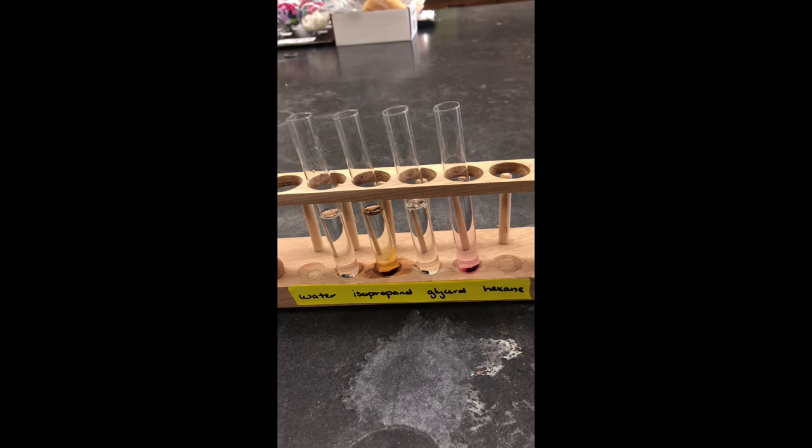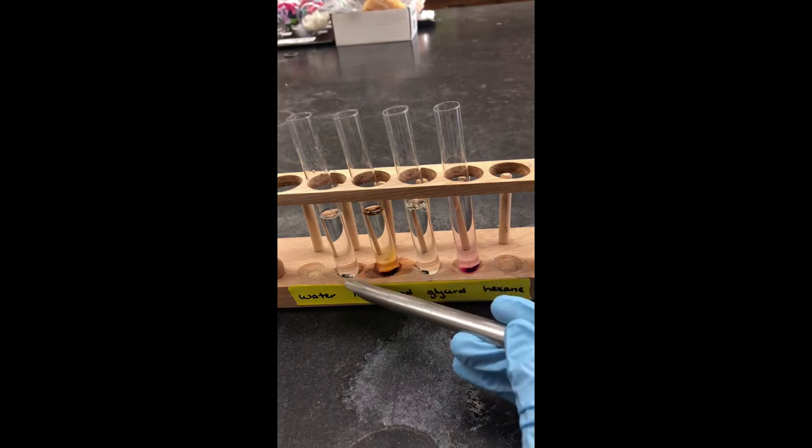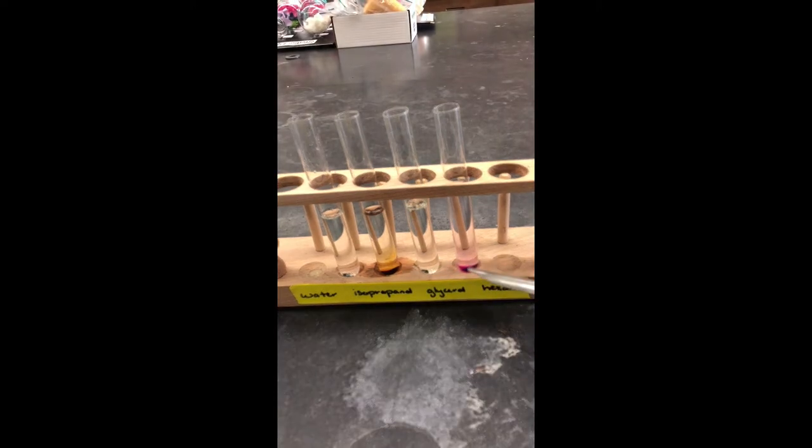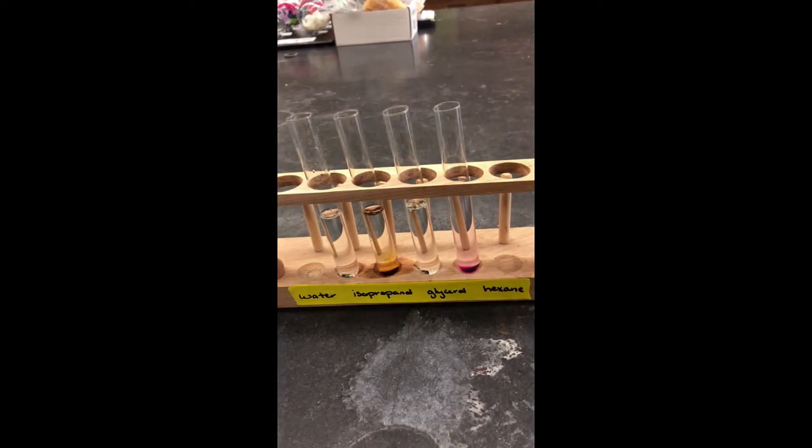I haven't stirred anything or changed anything, but you can see that in the water and glycerol, the iodine is sitting at the bottom, while in the isopropanol and the hexane, the iodine is starting to dissolve.